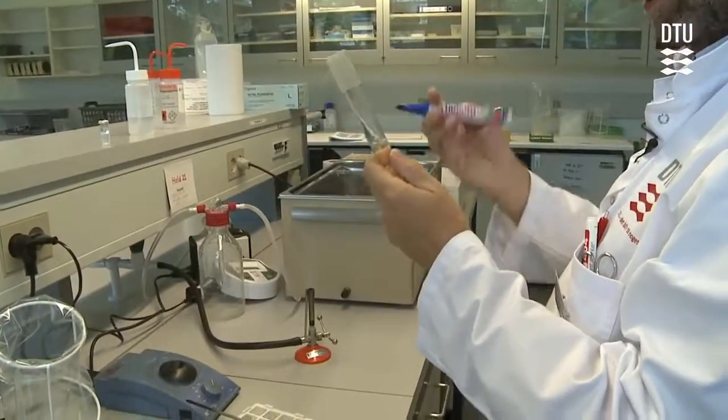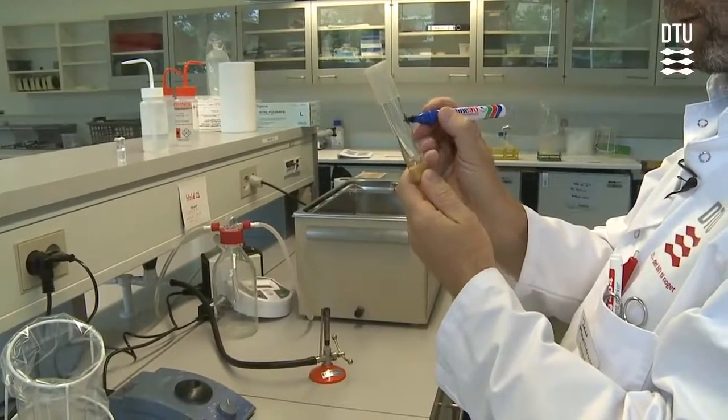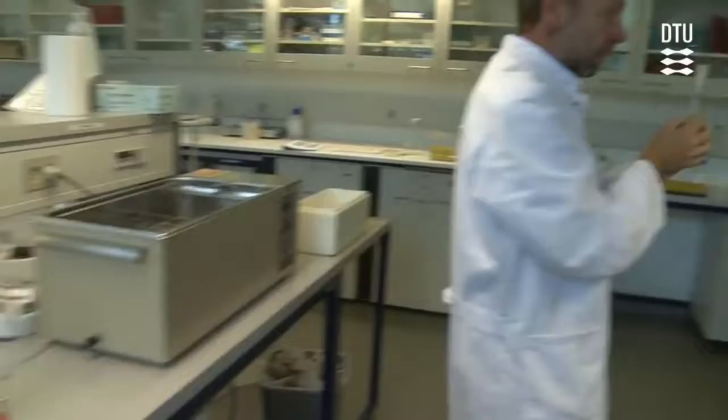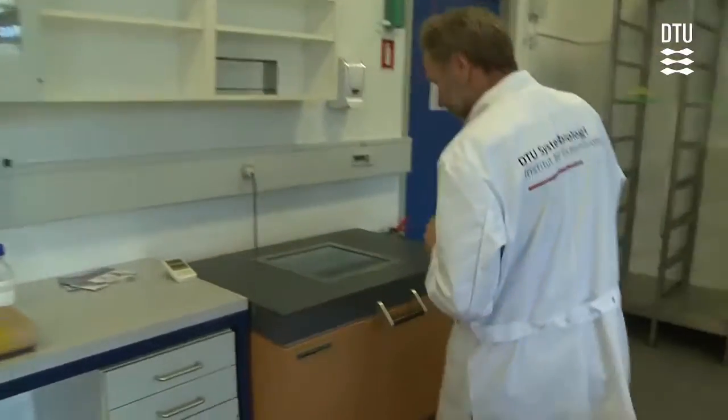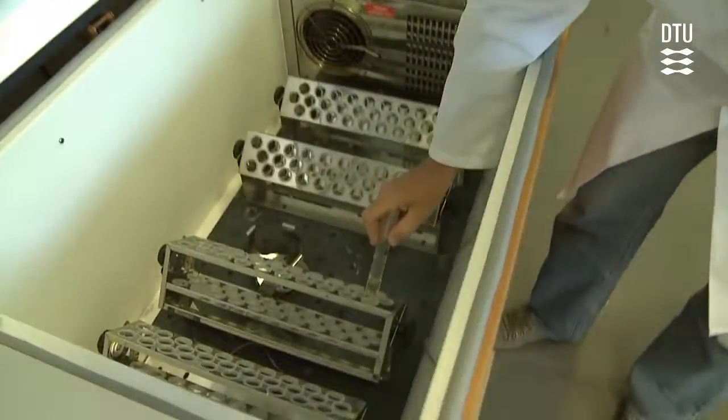Then, of course, you will remember to mark the tube, as always. Now it is time for the bacteria to grow for a couple of generations, so they grow in the incubator at 37 degrees Celsius.